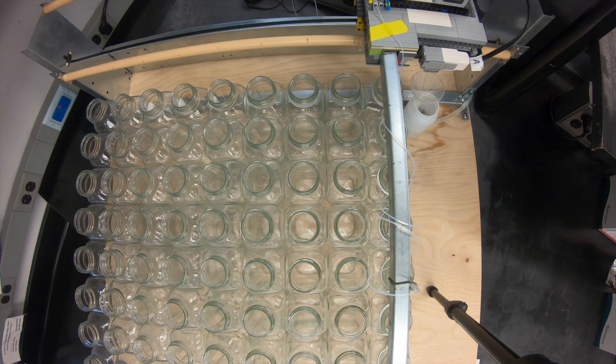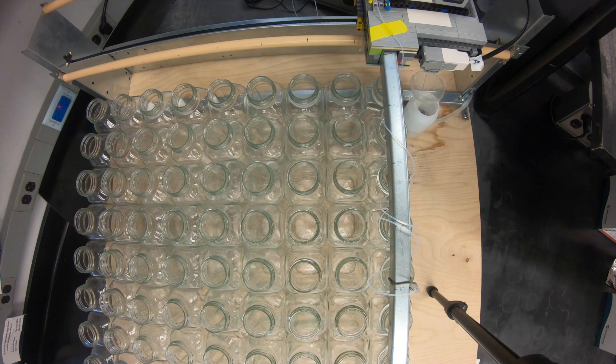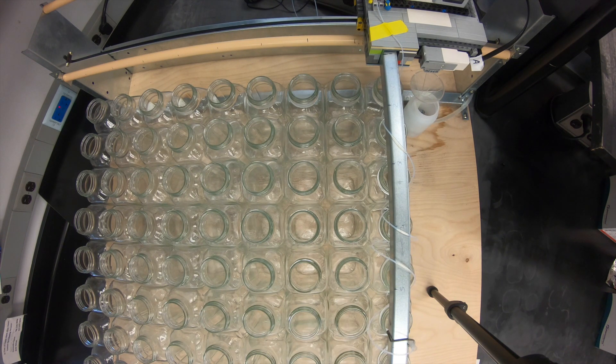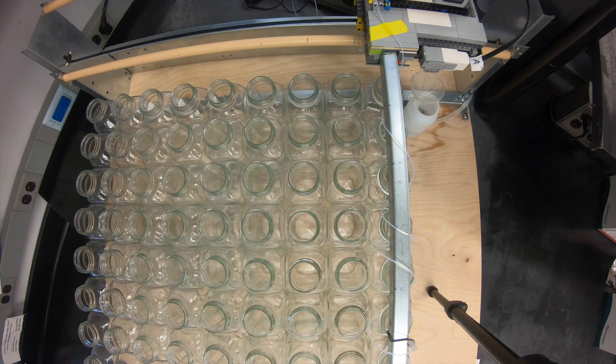We have the method set so that the pump automatically turns off. The flow rate on the PREP HPLC system goes to zero at the end of the method. Therefore, the fraction collector will turn itself off without having to have any complicated switching valve unit installed.